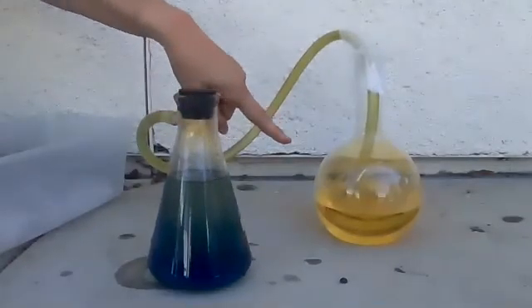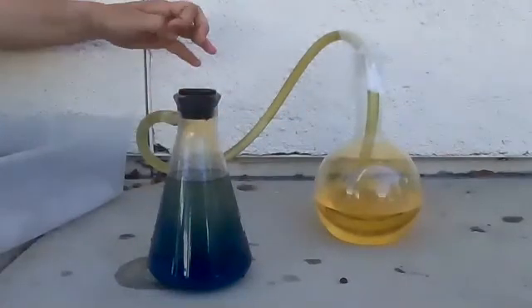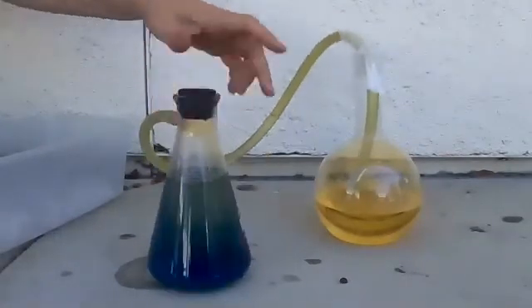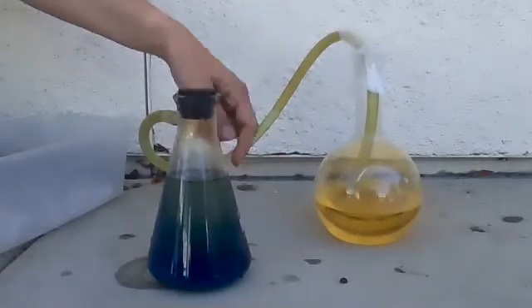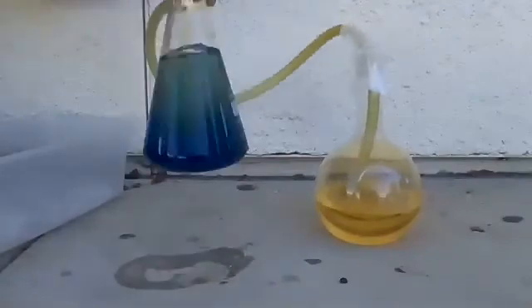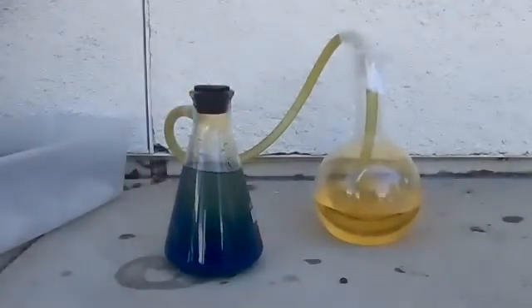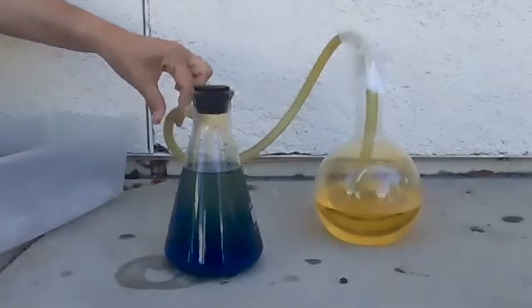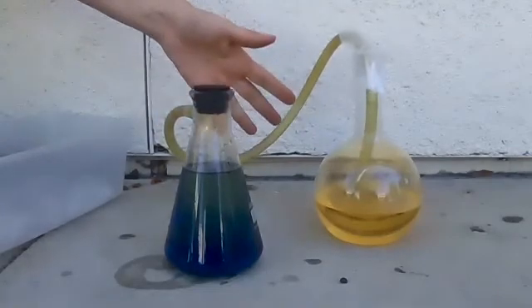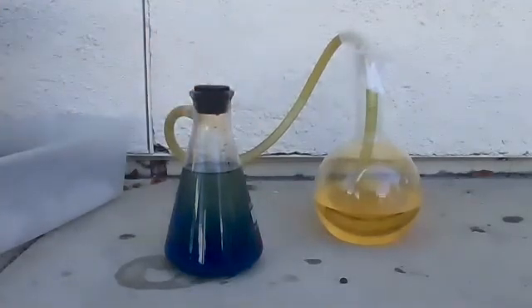There's acid in there so I've got to be careful — I don't want to spill that on me. We've got the water, the indicator, a little bit of indicator went back in here as well, and then we have our lovely copper nitrate. So we made gas, we made the pollutant NO2, and we made acid rain.